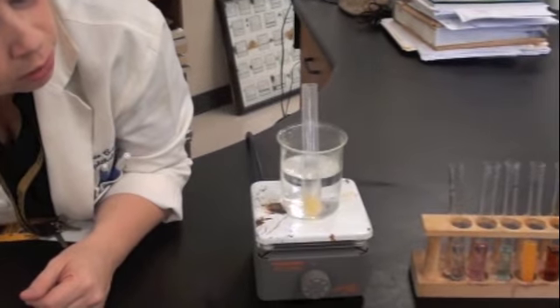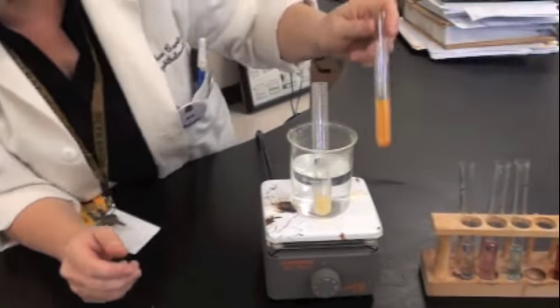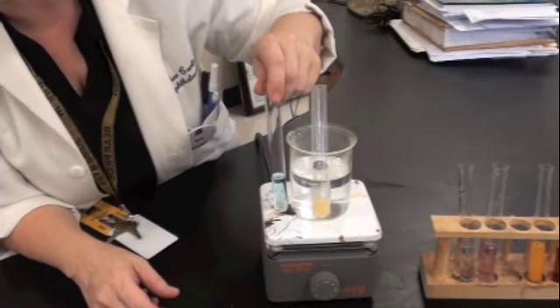A little more or a little less drops in the test would make it a bigger deal. And I think we're almost there. It's not quite as robust and in your face as that, but it's definitely not like the negative.